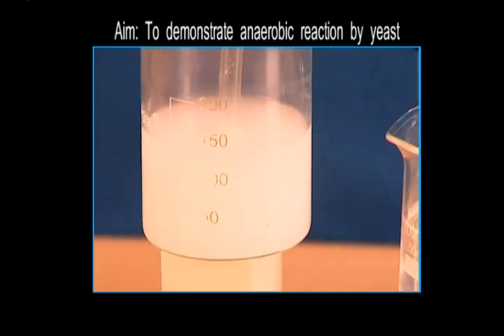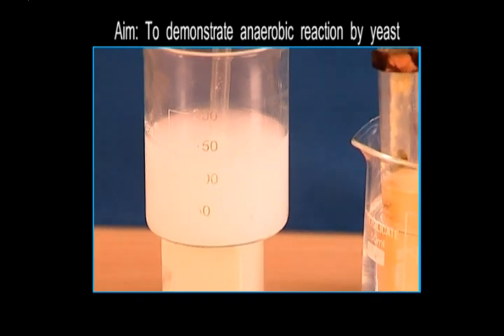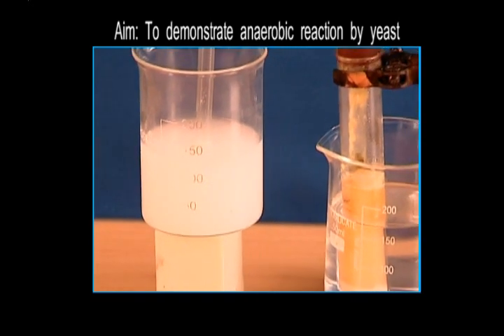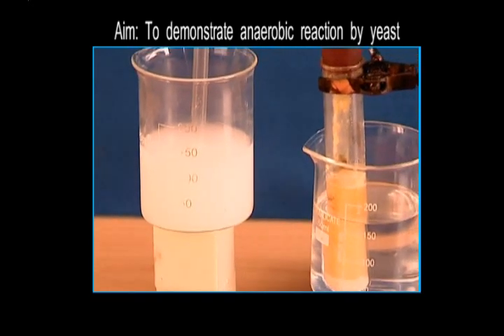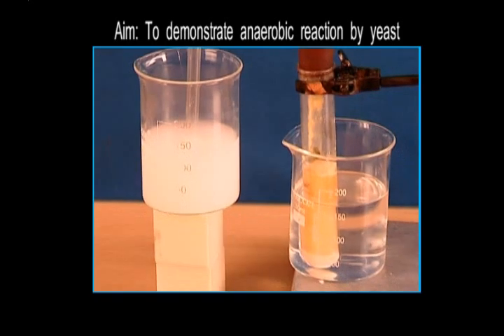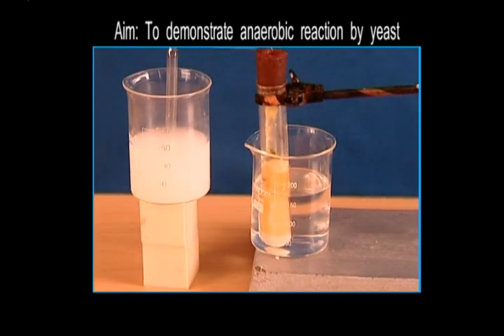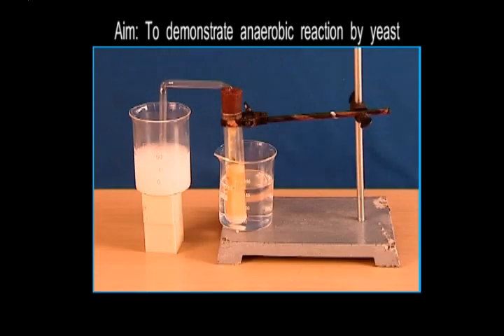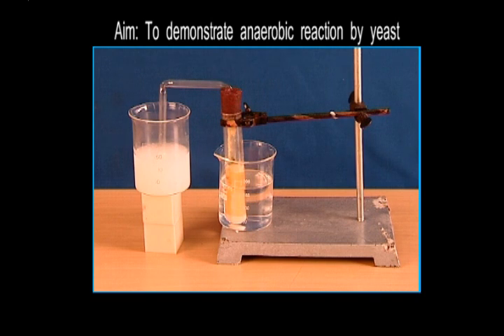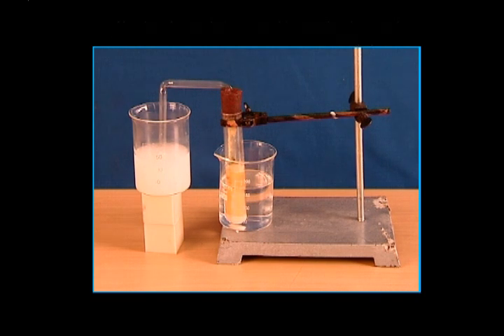This is happening because the yeast that we added has been doing anaerobic respiration in the absence of oxygen and releasing carbon dioxide. It is this carbon dioxide that turns lime water milky.